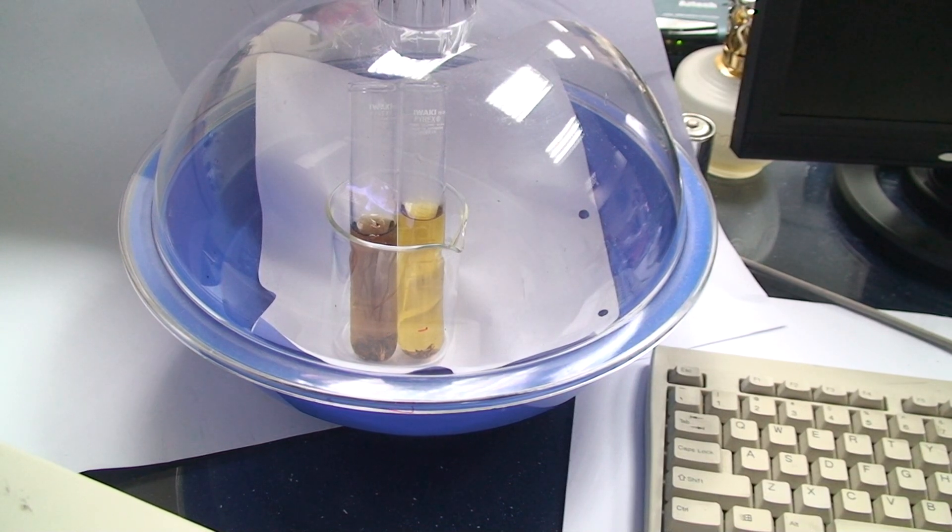Alright, what we have here is the left test tube is Coke, Coke Light, Coca-Cola Light.